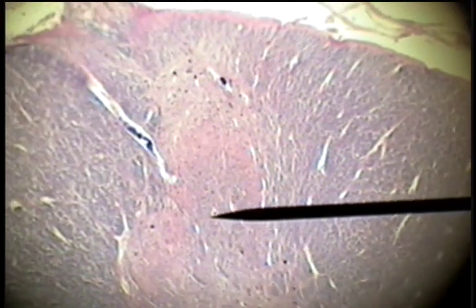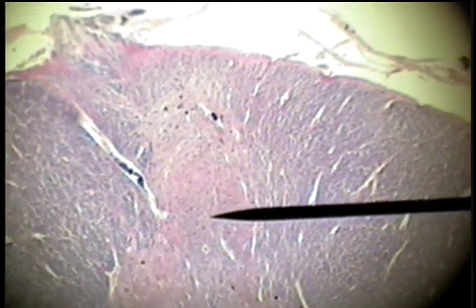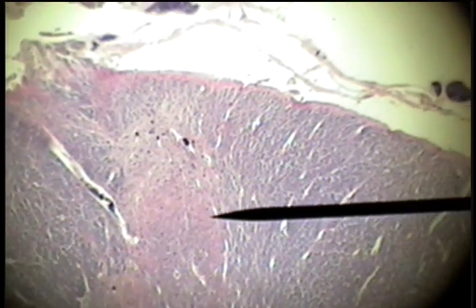This is the nervous system tissues. This is the spinal cord. It's so large that even under low power we won't be able to see all of it.